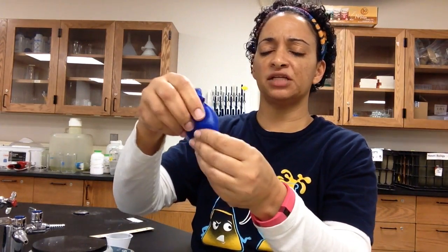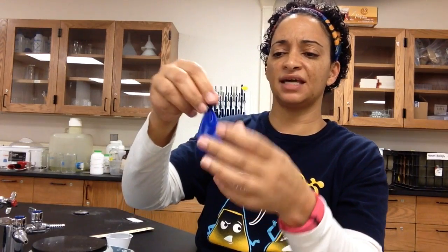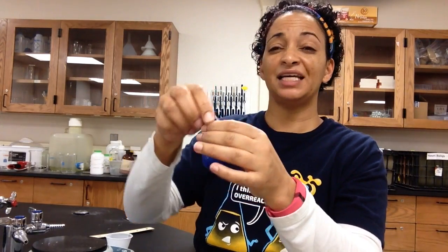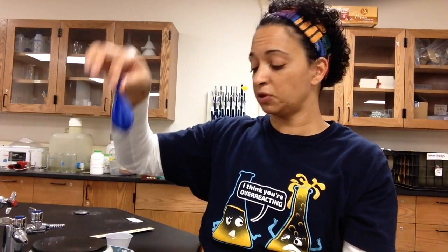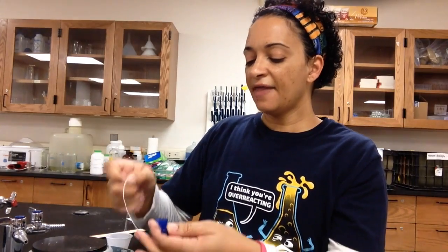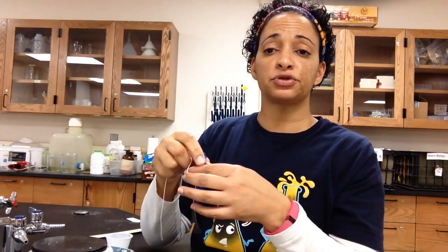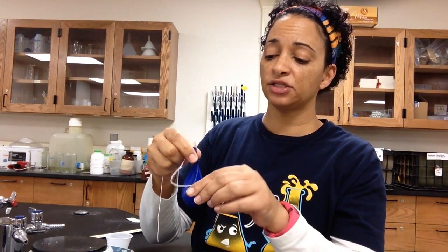I'm going to squish it so I get that yeast and glucose all mixed together. Then I need to make a couple of measurements. First, I need to mass this balloon — I'm going to put it on my balance to find the mass, and that will be my initial mass of my balloon.